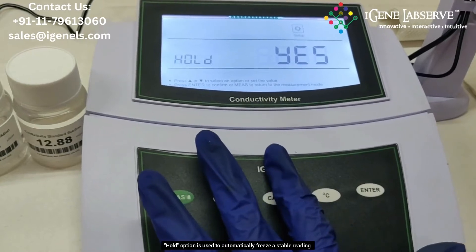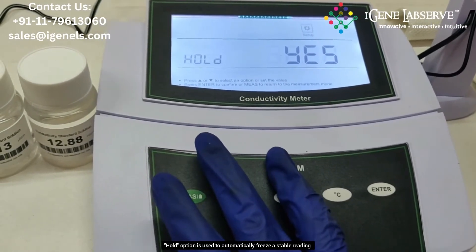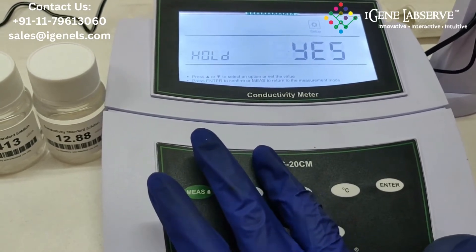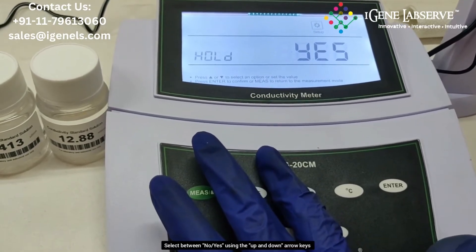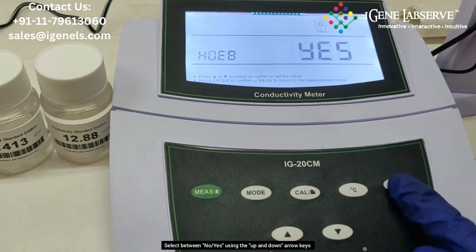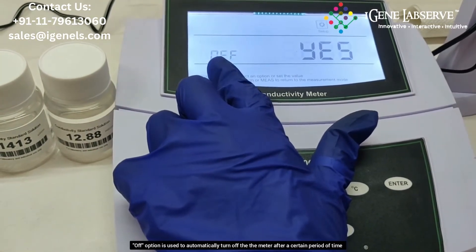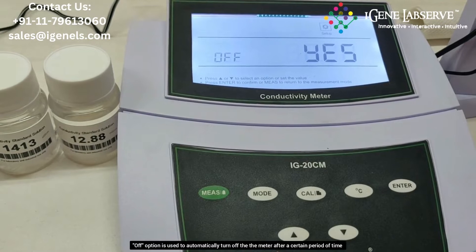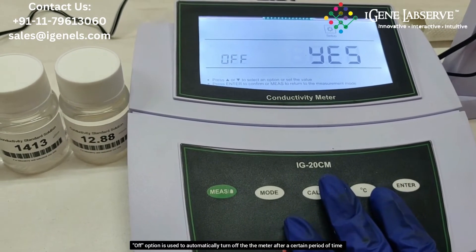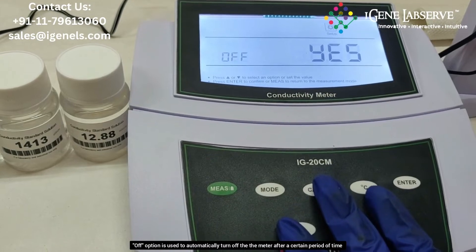The auto hold function is used to stabilize or freeze the readings when the machine detects that the readings are stable and not fluctuating. Press enter. It goes to the auto off option, which means that if the machine is left on for a certain period of time it will automatically turn off.